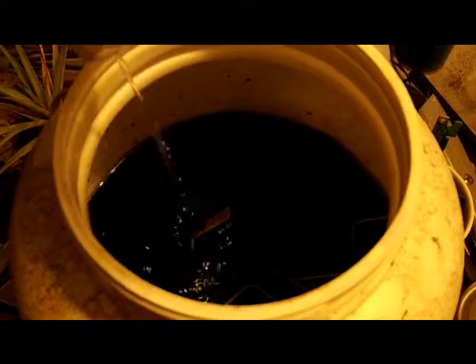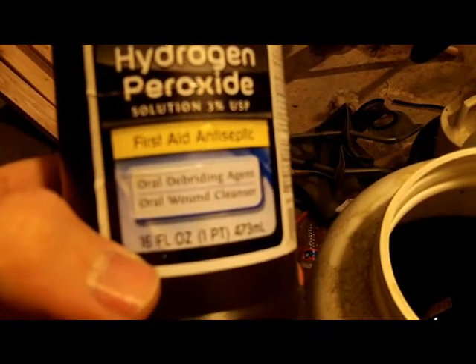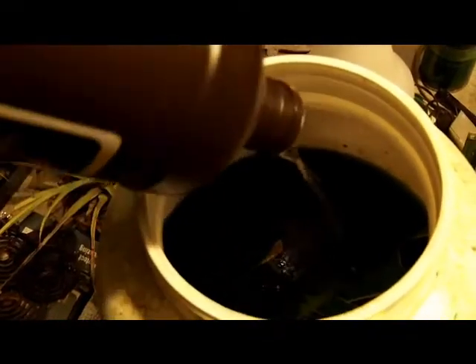I'm going to throw some water in there. Another thing you can add is just some regular hydrogen peroxide — just regular store-bought, it's like three percent, not a lot. Add a little bit of oxygen to it to get things going, or you can put a fish tank bubbler in there, which speeds the process along as well.